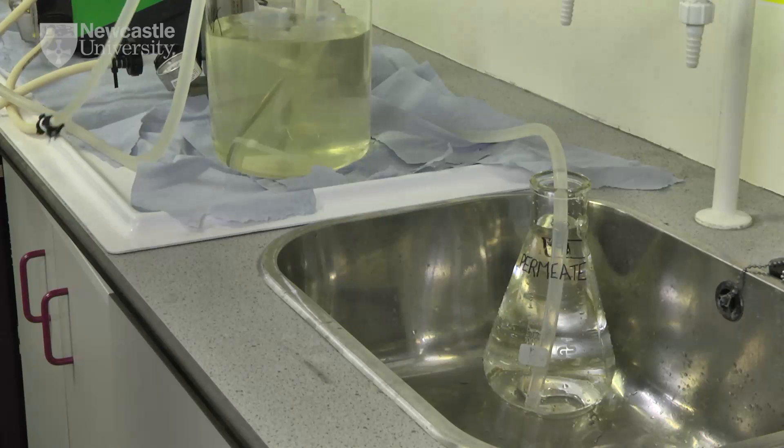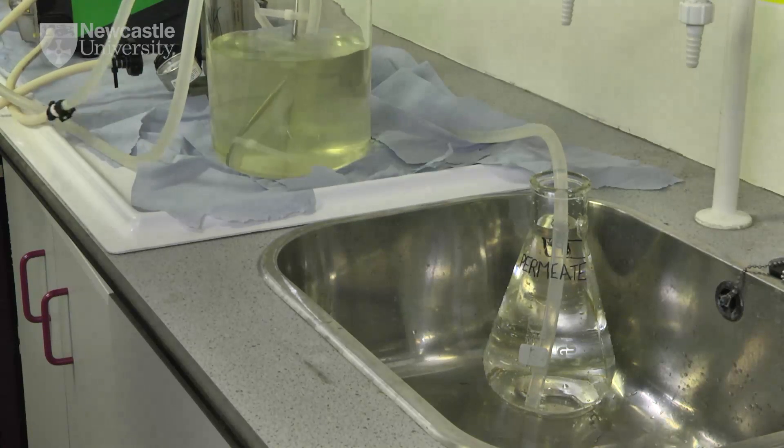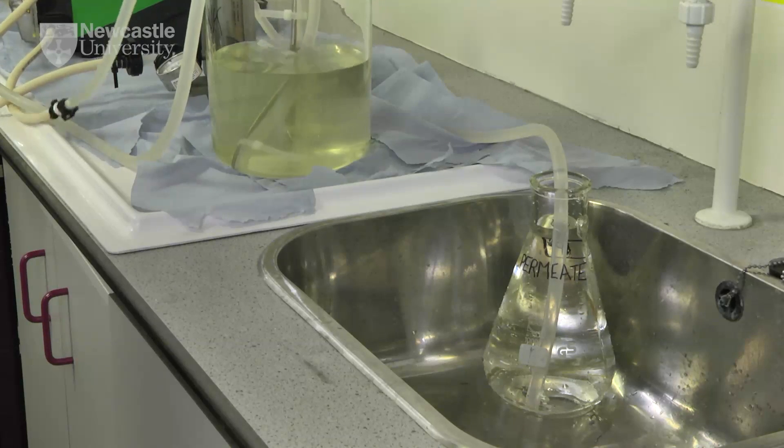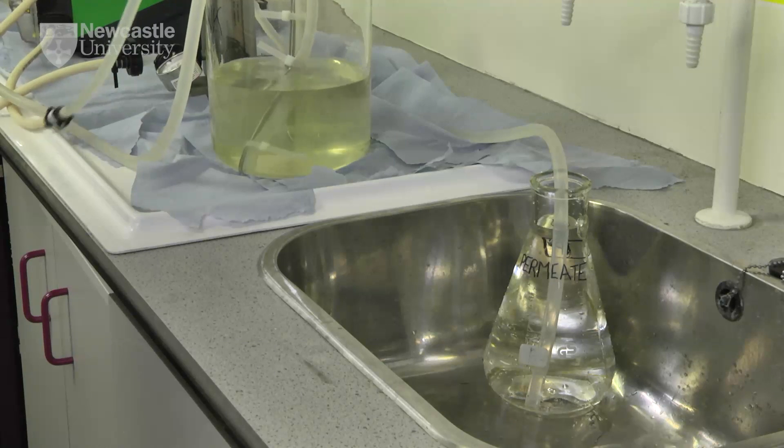They should be set to create a transmembrane pressure significant enough to encourage filtration, but not so great as to significantly reduce the flow across the filter, which may lead to the formation of a gelatinous surface layer.